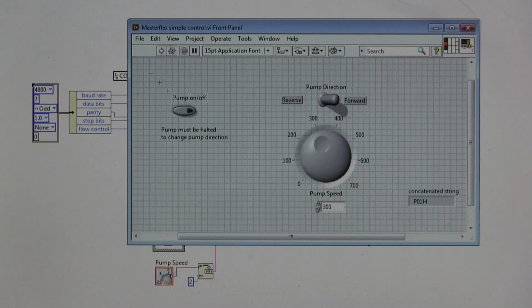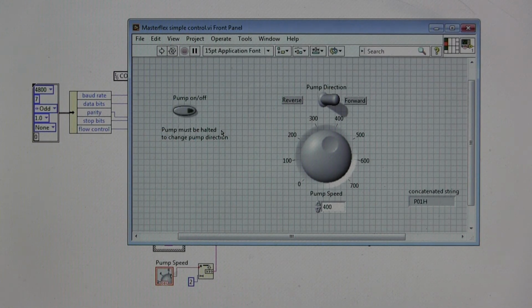Here's the concatenated string. So let's run this again, and we'll see that the concatenated string that it received this time was P01H, which was just the halt command for pump number one. If we turn the pump on and run it, the string that was sent is P01S plus 300 G0, and again the S means set the pump speed and whatnot to positive 300 and go continuously. Let's try altering the pump speed to 400 and run it again. And here we have P01S plus 400 G0. All right, I think you probably get the point now. Let me turn the pump off, and that is a brief introduction into LabVIEW communications with the Masterflex pump.